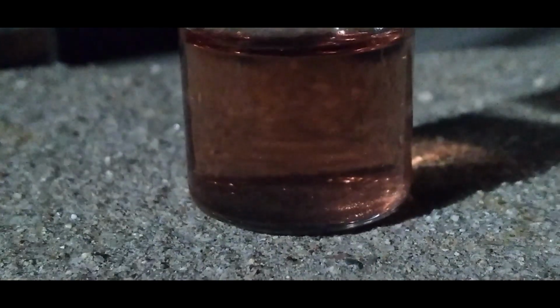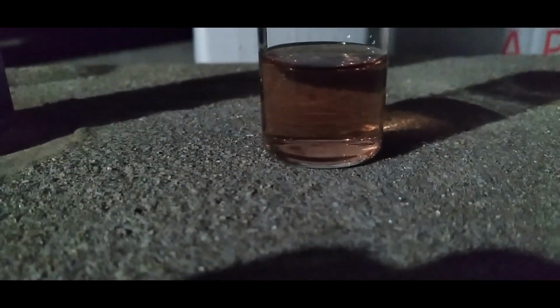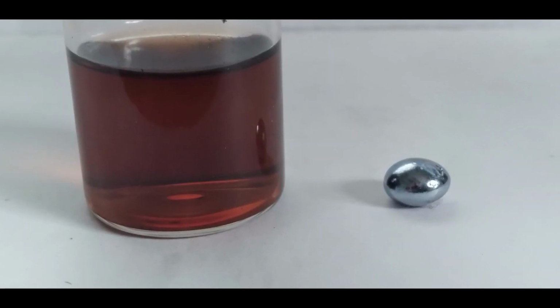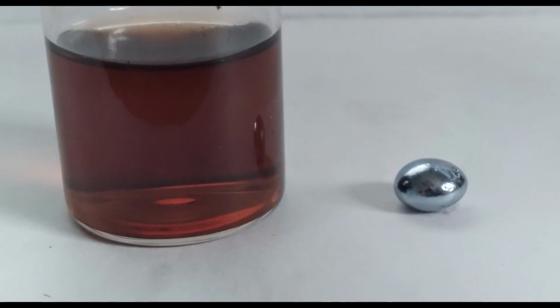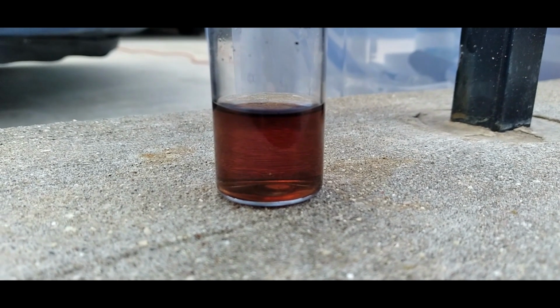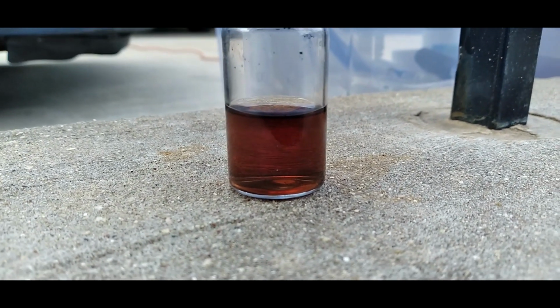At this point, I started getting really anal about getting osmium dioxide out of solution, so I tried adding sodium hydroxide to force it to precipitate out. After adding the first addition of sodium hydroxide, the solution was still so acidic that the osmium dioxide redissolved. At this point, I decided to just work with what I've got.